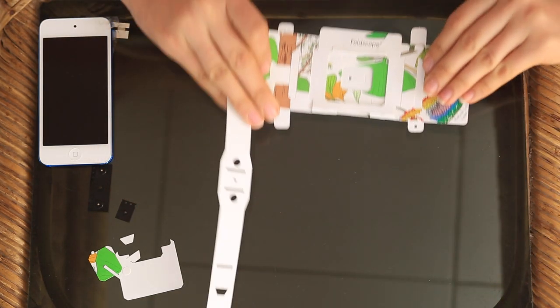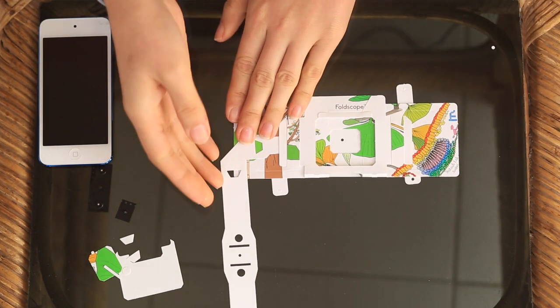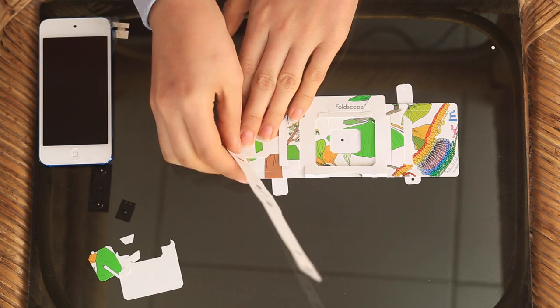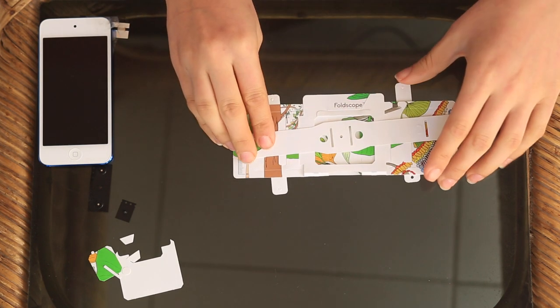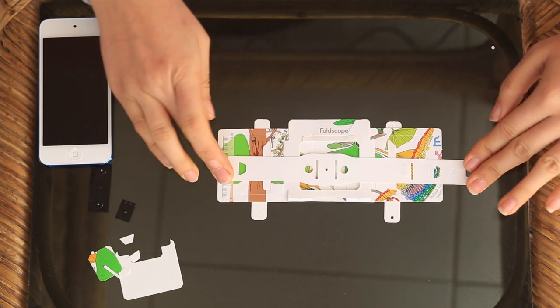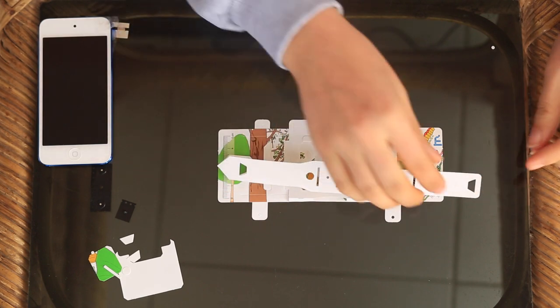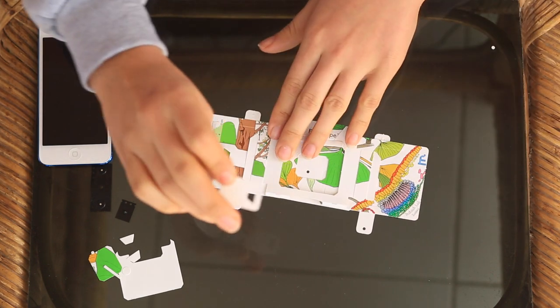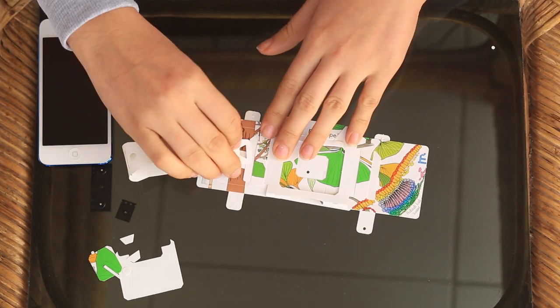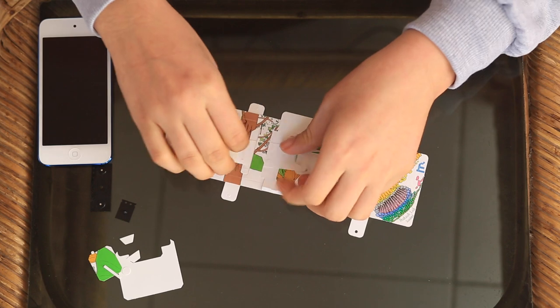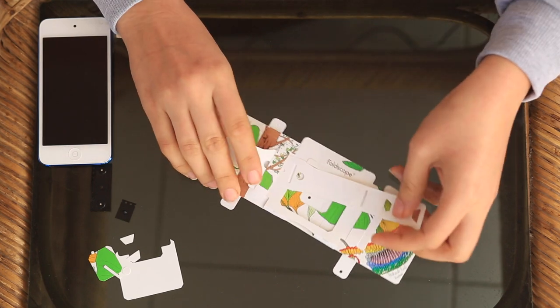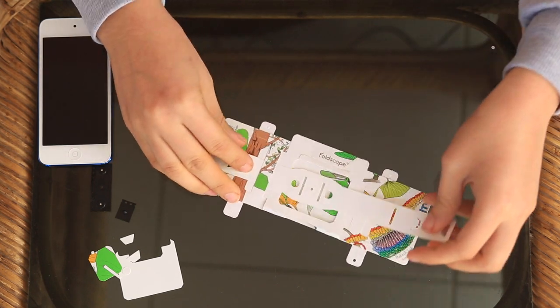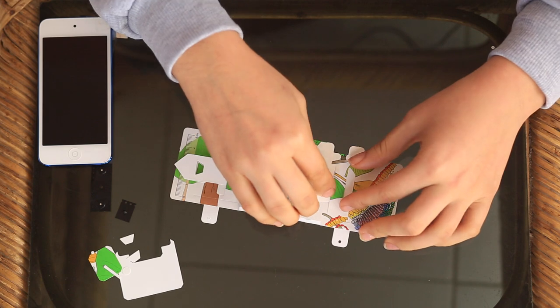Then you turn it back to the front. And you fold the top part of the illumination stage over so it lies flat like that. You again take his tail and you weave it through underneath here and also underneath here.